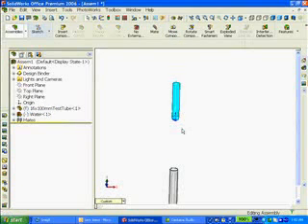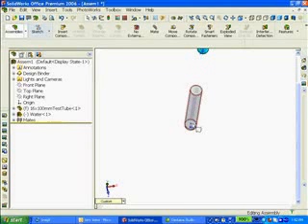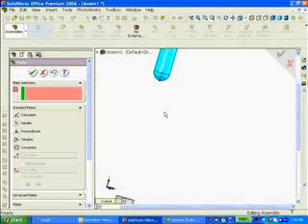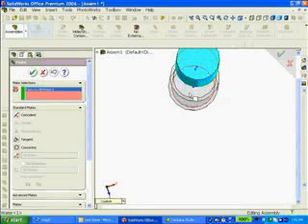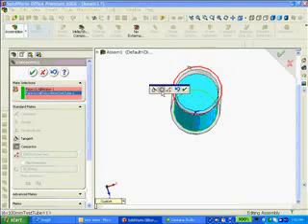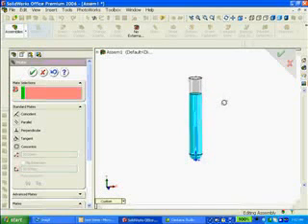The two are concentric. The next thing, the bottom spherical face of the water must be mated inside the bottom spherical face of the test tube. So I will select on mate. I'm going to select on the spherical face. And then inside the tube, rotate this around and select the inside face of the tube. Concentric is selected by default, and I click OK. Now I have the water inside the test tube.